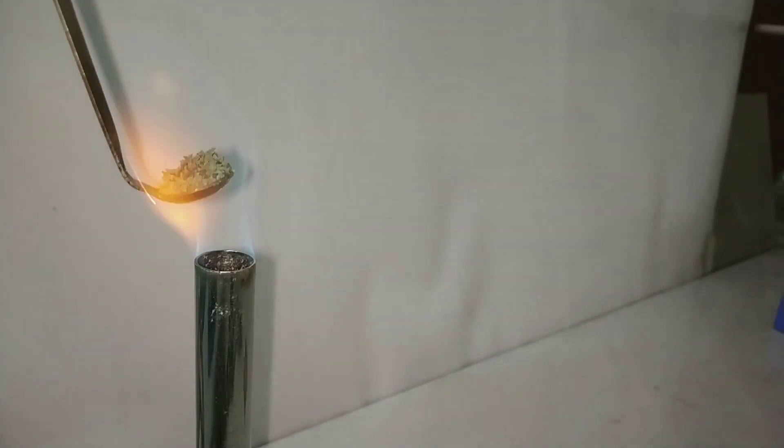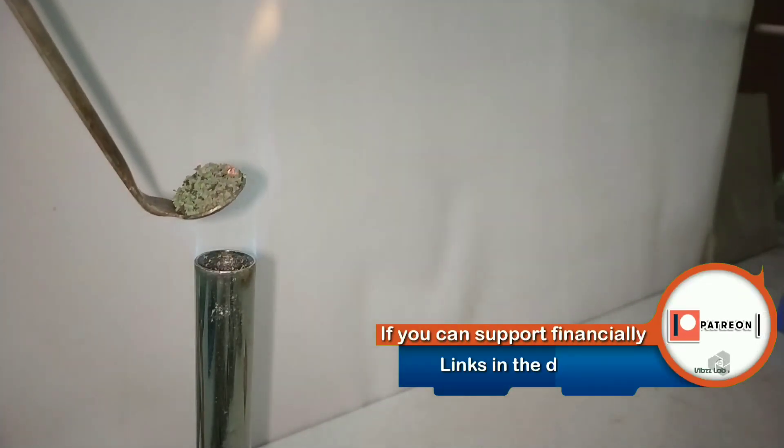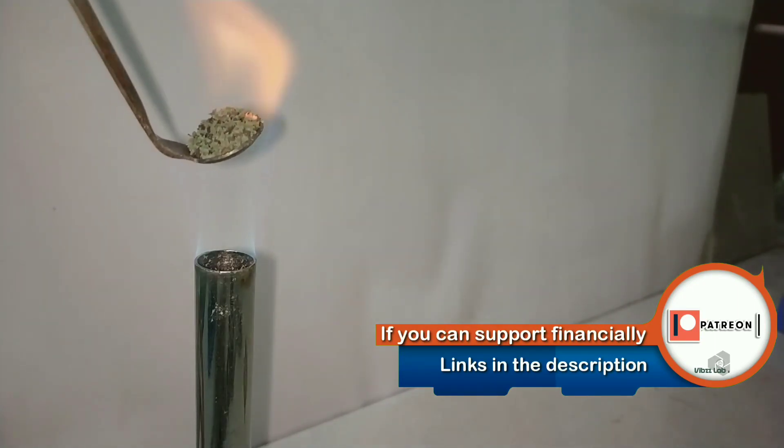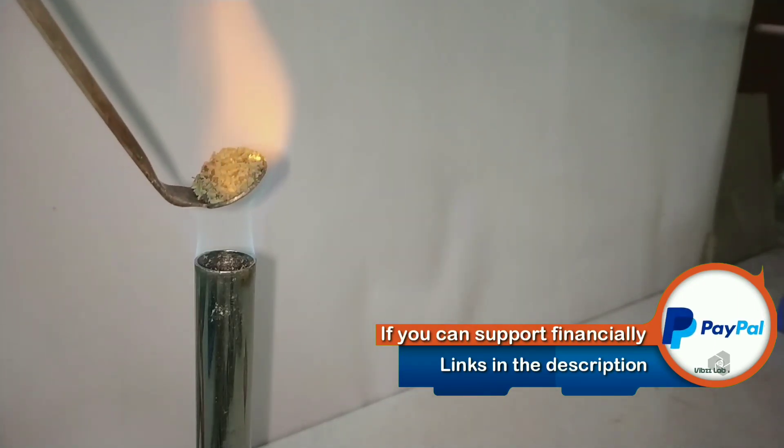In the next step I heat up some of the chromium 3 oxide formed on a Bunsen burner flame until the compound becomes red hot.